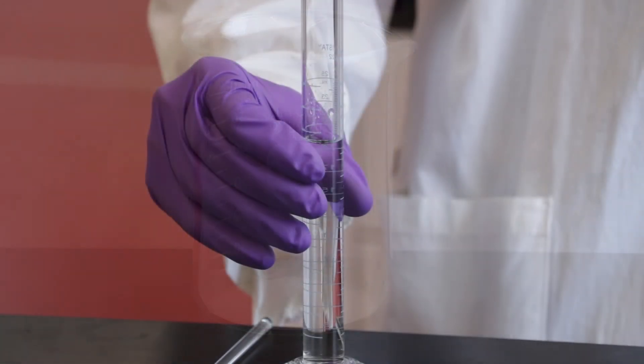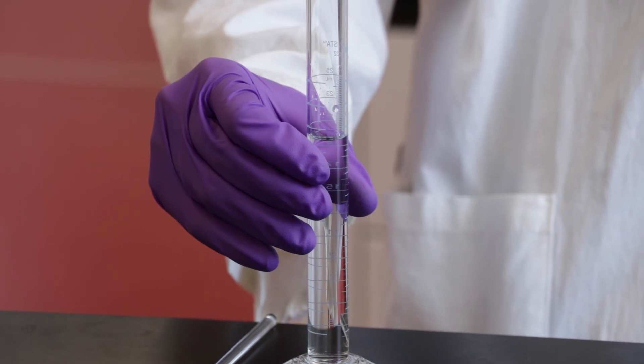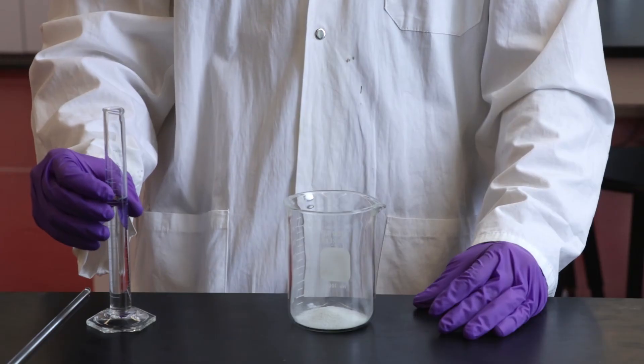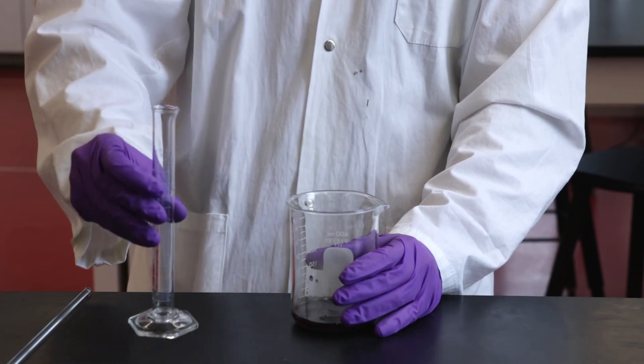Next we add 20 milliliters of water using a graduated cylinder. While graduated cylinders can measure volumes more accurately than a beaker, they are still considered estimates and should not be used when an exact volume is needed.